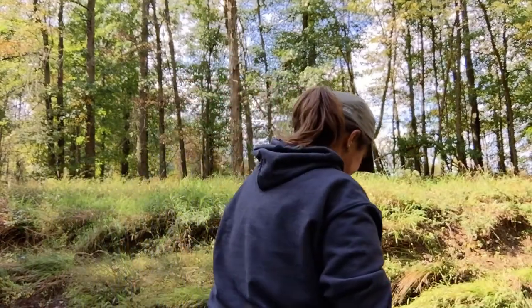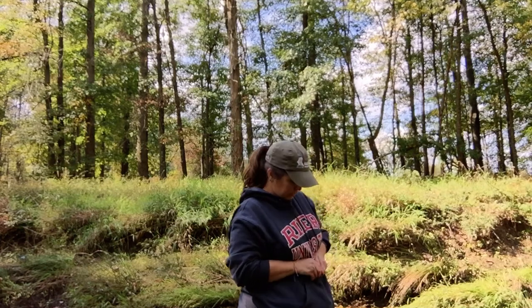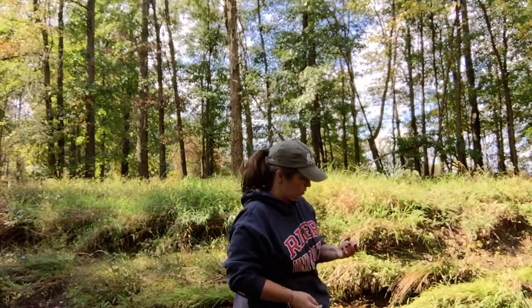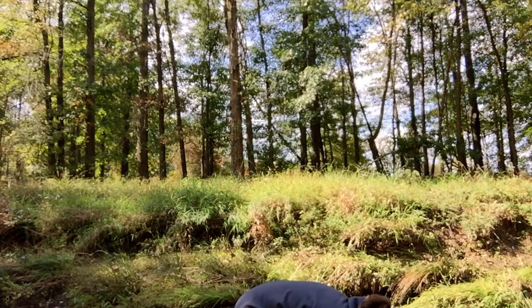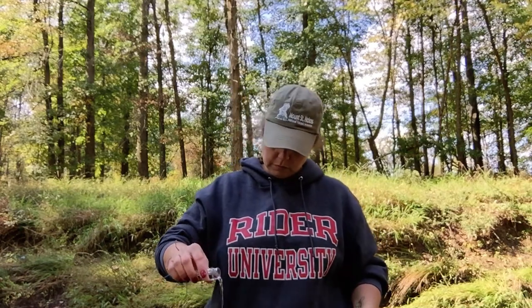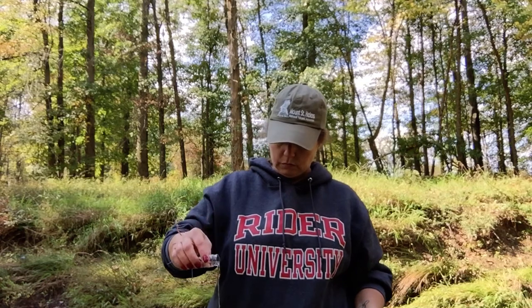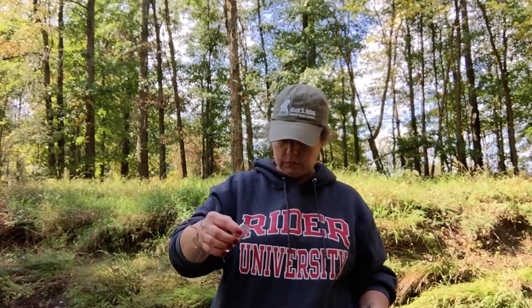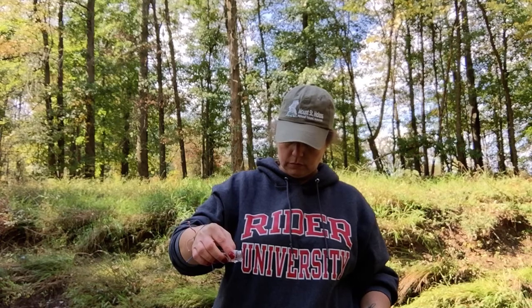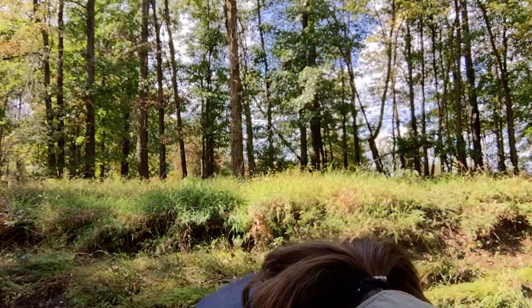I'm going back to the creek sample. If I put too much, you can just pour a little out. Okay, five milliliters - we're good. Now it tells me to add one of these indicator tablets.